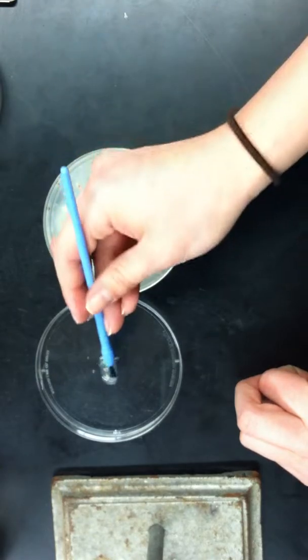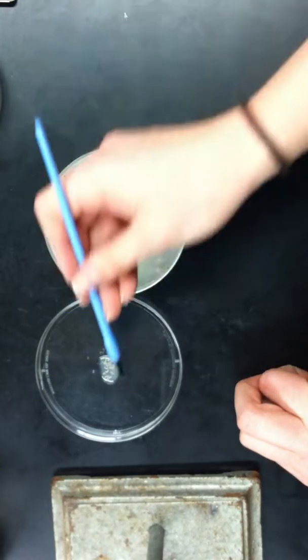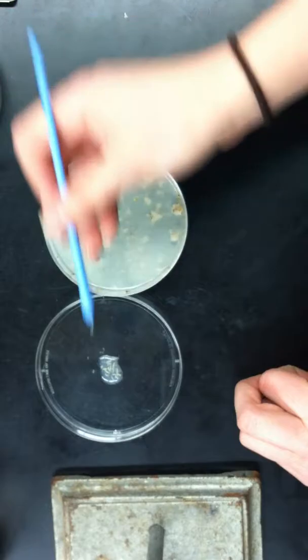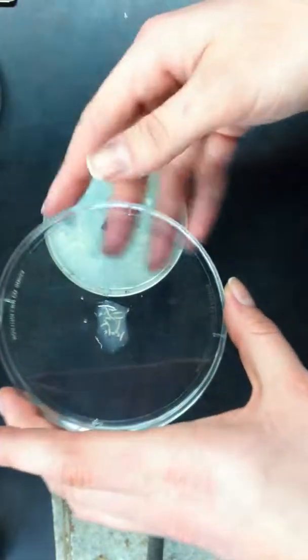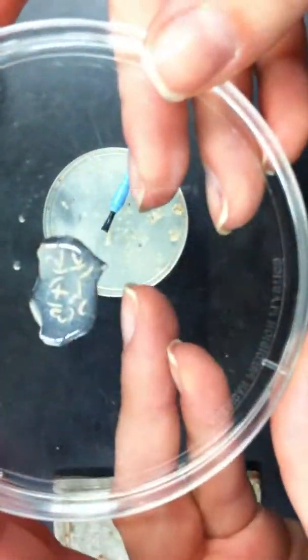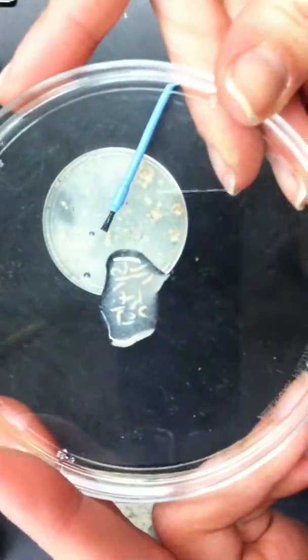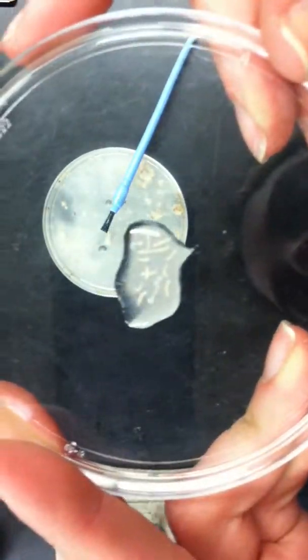So all these are floating to the top. They're easy to catch. And then after a while, I mean, here's probably only like 10 or so, 15. After a while, they kind of sit in this pool. And here are the larvae you're going to use, and then you transfer them to your training plate to begin training and testing.